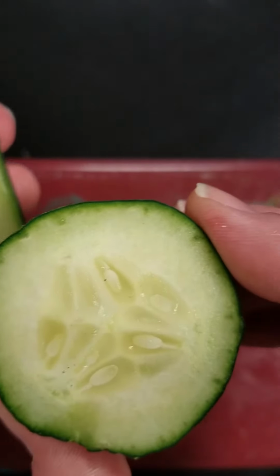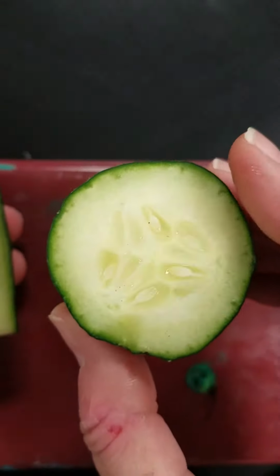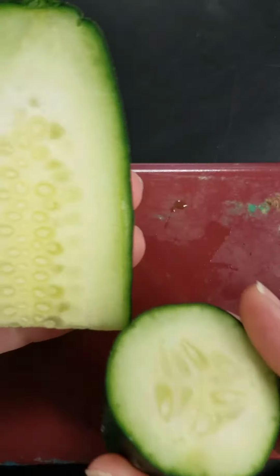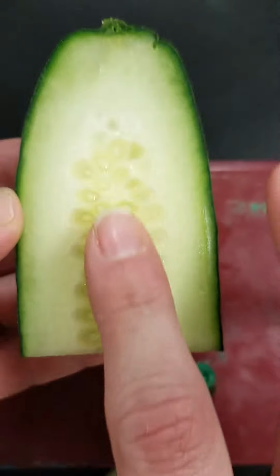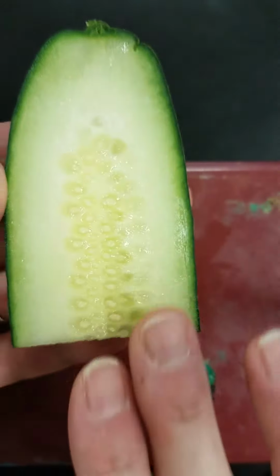A lot of the slides that we are going to look at would be made using the cross section approach so that you can get across through the entire organ. But occasionally we'll have what is referred to as the longitudinal section, or the LS, where we get a longer view, not a cross-sectional view, but a longer view down the length of the organ.